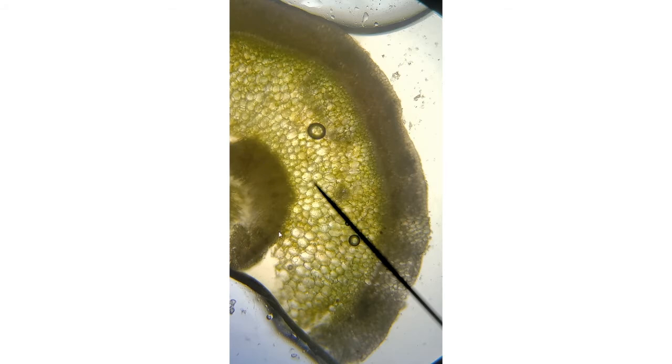So if you look carefully, the endodermis would be right here. This is the xylem. You can actually see the dark spots. Those are vessel elements that are in the xylem. It's actually got a pith in the center, which should tell you what group of plants orchids belong to. So you'll want to know those parts. Those are all the parts that are in bold, and hopefully you know those for the test.